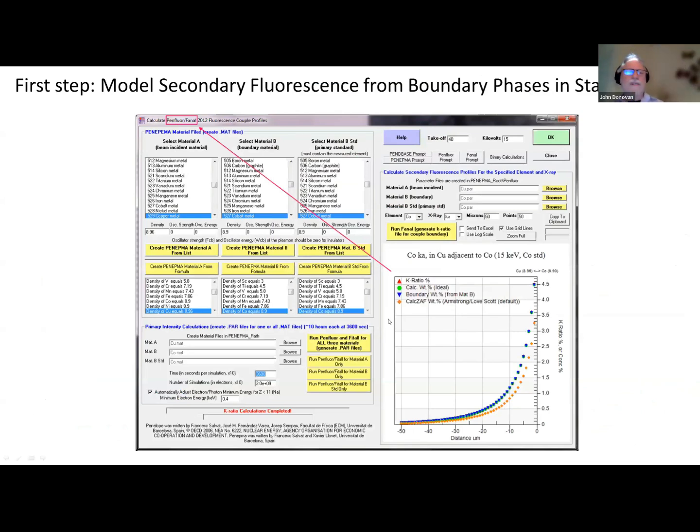Okay, let's go over this again. First step, model the secondary fluorescence from the boundary phases in standard.exe, which comes with CalcZAF, free download. And then you'll see what you got. The default example that comes up in the software is measuring cobalt K alpha in copper. And this was the example that Raymond Castaing pointed out 60 years ago.